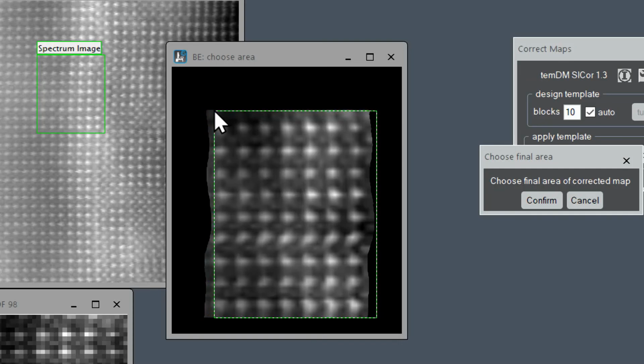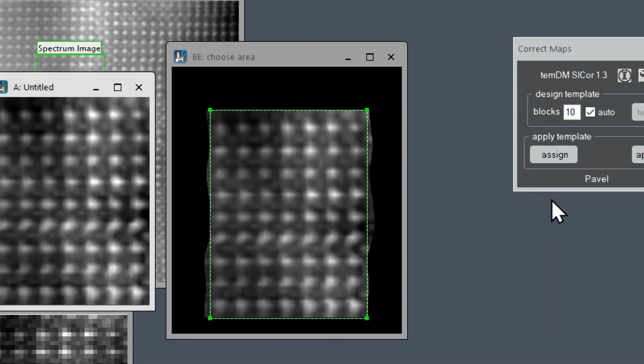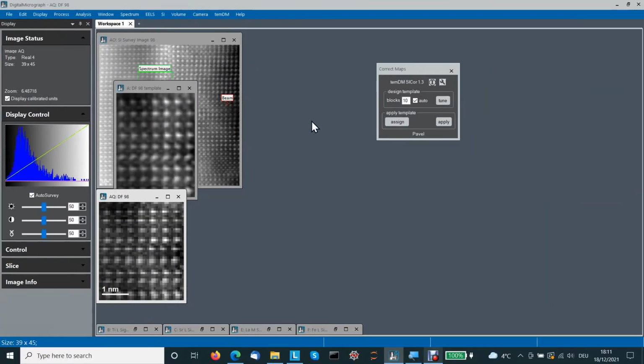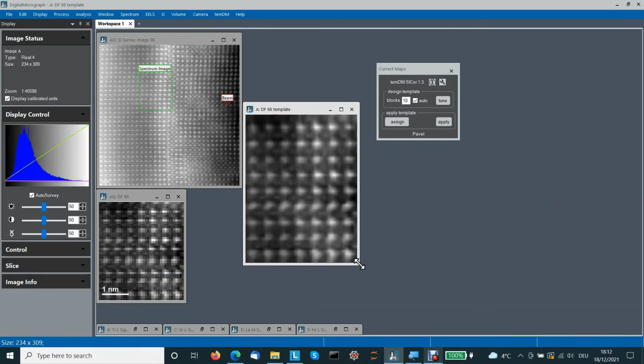Okay, now we are offered to choose the final area for our maps. It's worth cutting off these ugly wavy edges like that and accurately correcting the upper and lower sides. Then confirm. Good. So what do we have? We have the corrected dark field image, but that's probably not what we finally want.